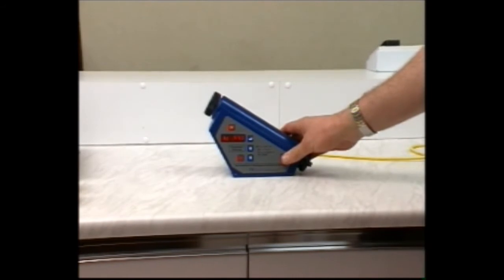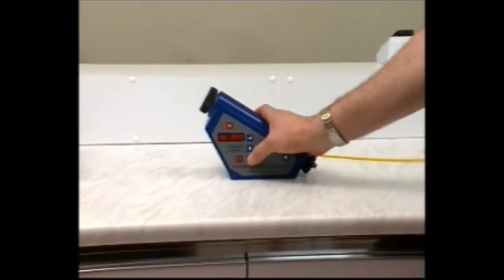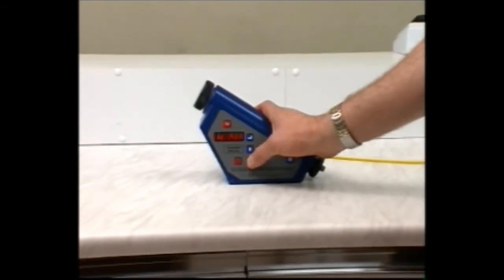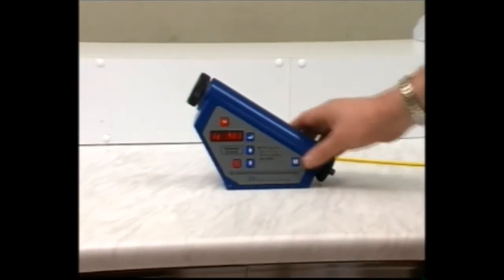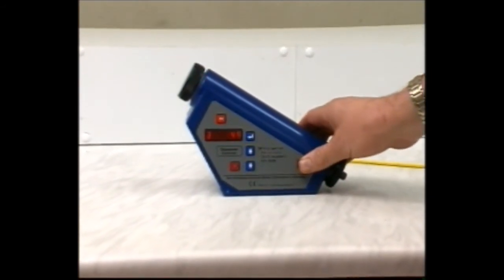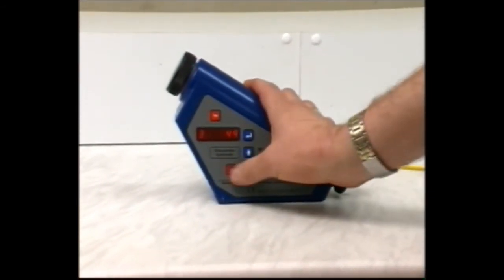Using the viscometer, use the speed and arrow keys to enter the density from the density meter in mode 1. You can move between corrected and uncorrected density by using the return key.